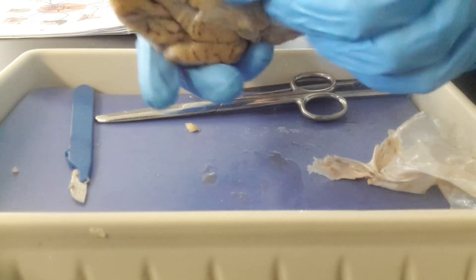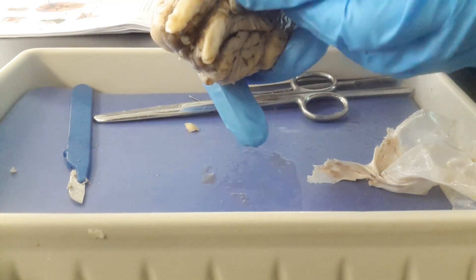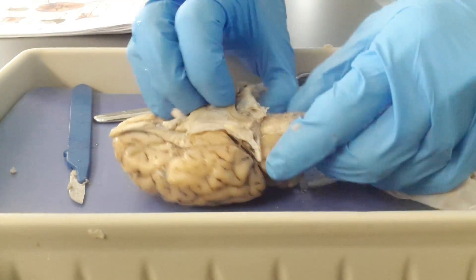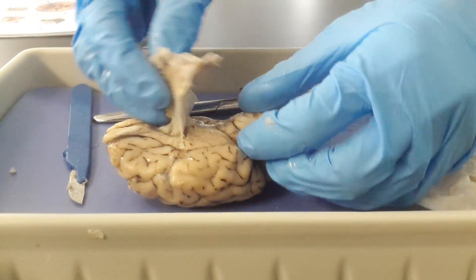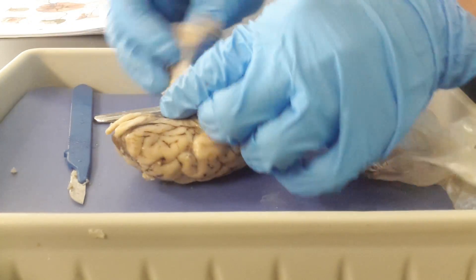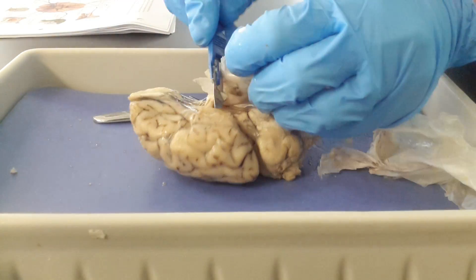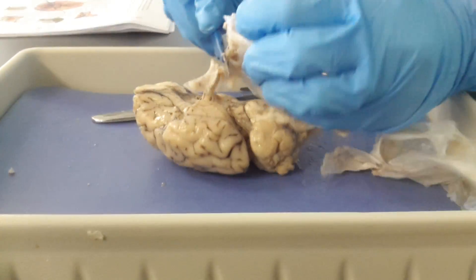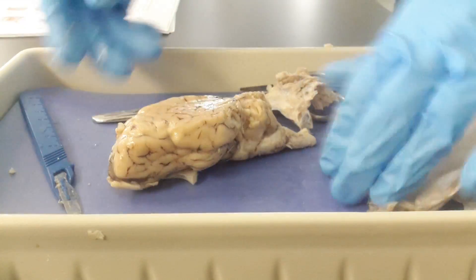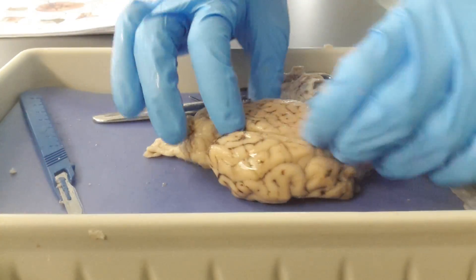Now that we have that removed, we can look at the superficial part of the brain and identify some major structures.